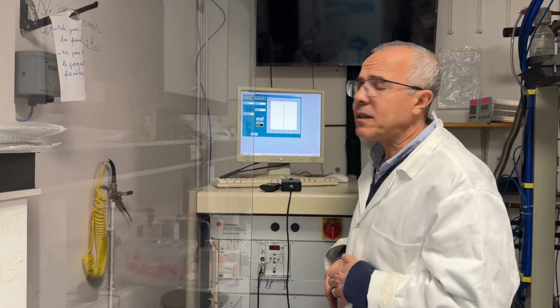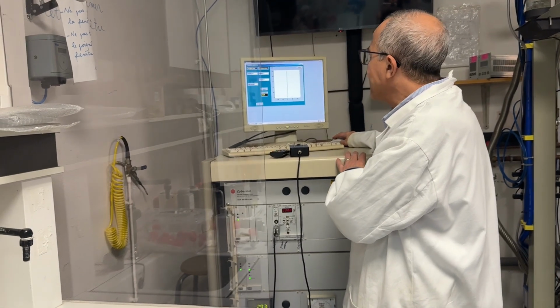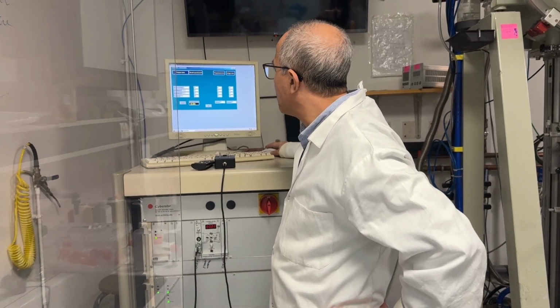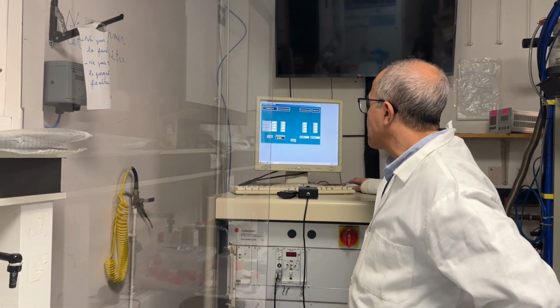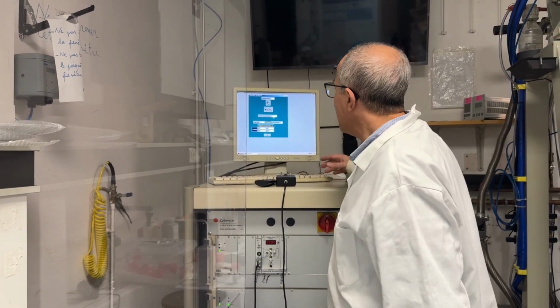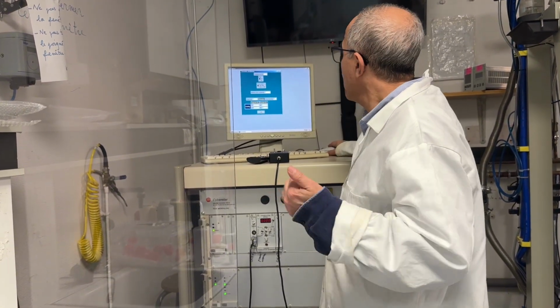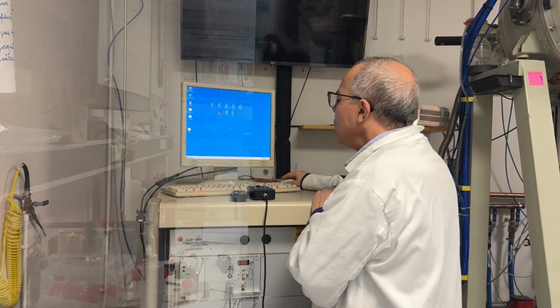I put the diameter, I put the mass, I put the density you see here, and after that I save. Then I go to the growth parameters, I put the cooling rate and the total time for the growth process. And after that, I put the maximum power of the generator that I will use, it is for security, and the cooling step, I will put, for example, here, when it is finished, we will cool within 2 hours. I save my data, and now I start to heat directly.